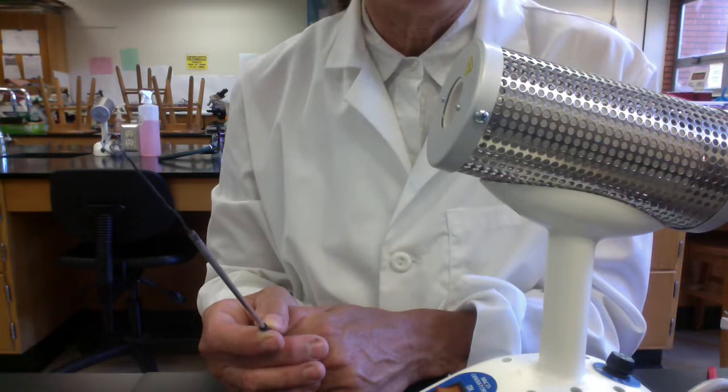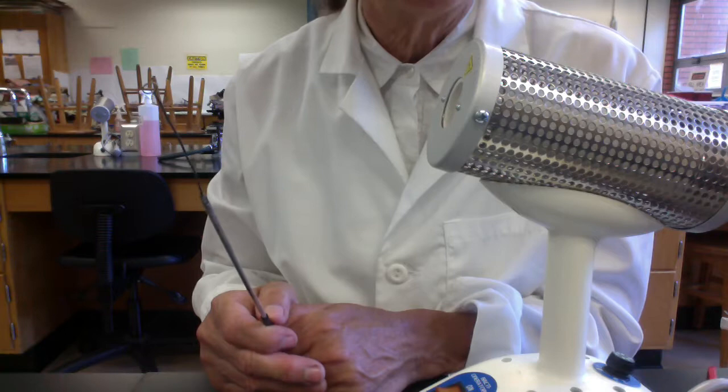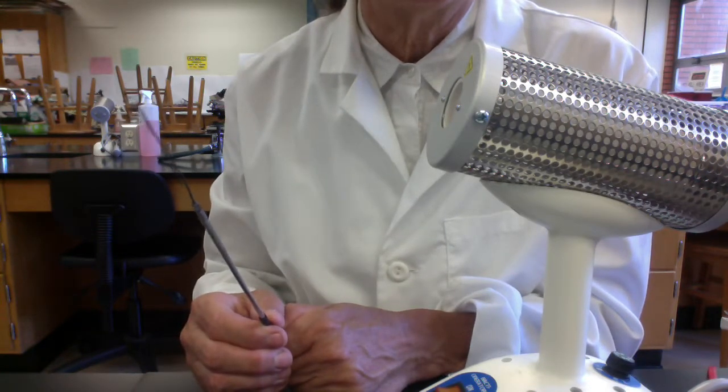Don't let it touch anything. If your loop touches anything here at the tip, consider that it's contaminated and you'd want to re-sterilize, start the procedure all over again.